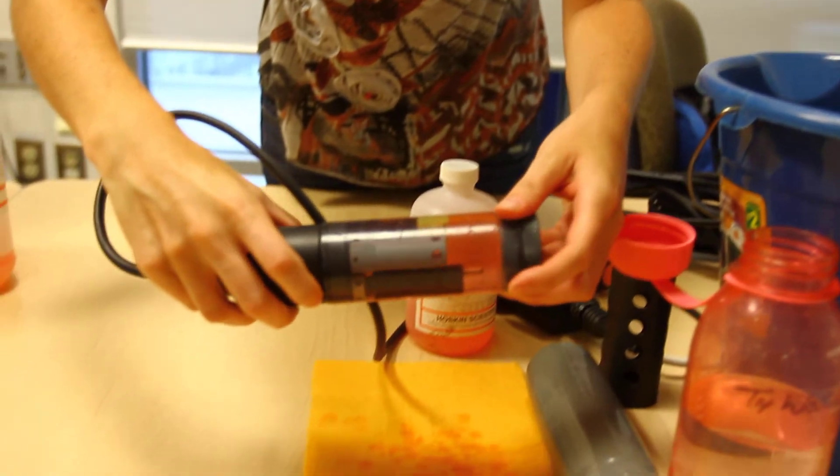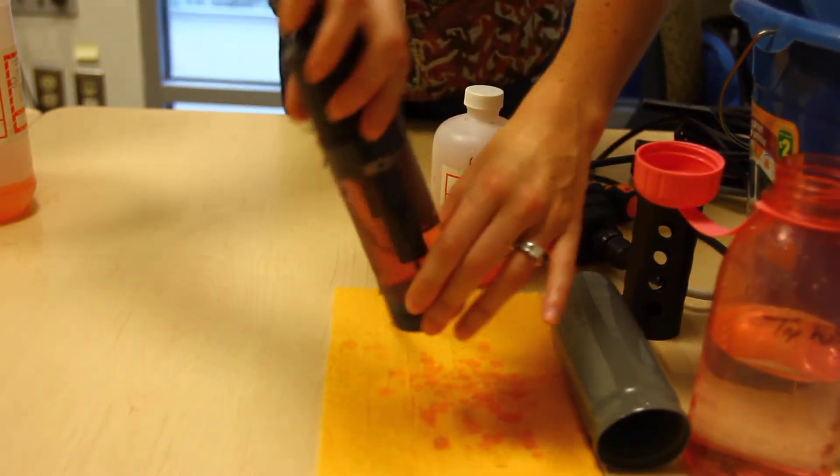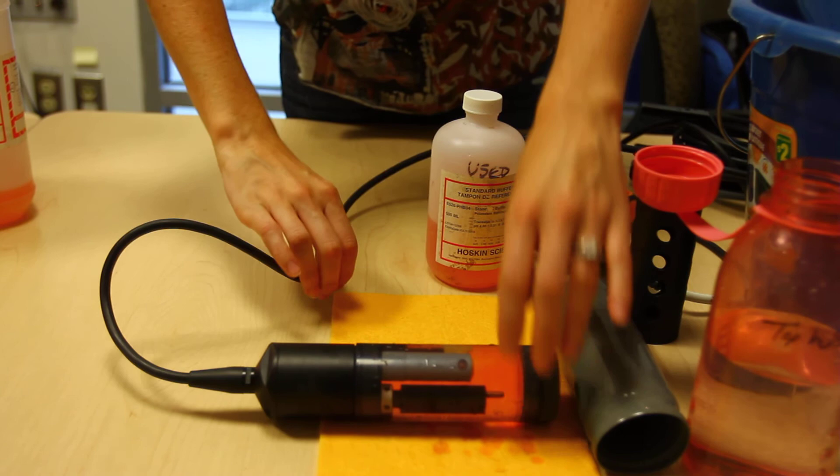If you don't have enough solution for long-term storage, contact the CURA H2O staff.